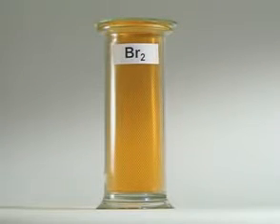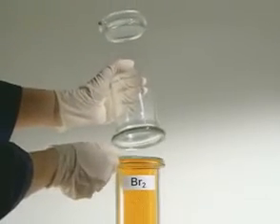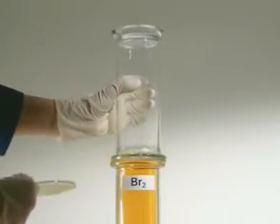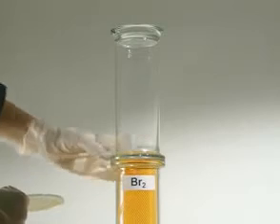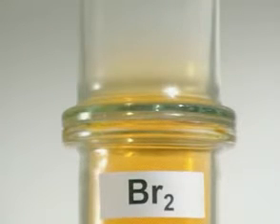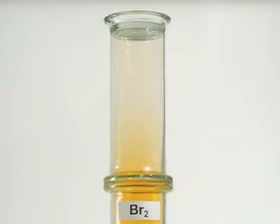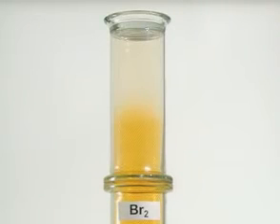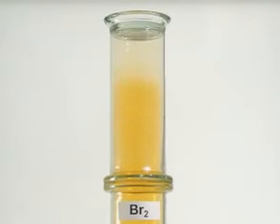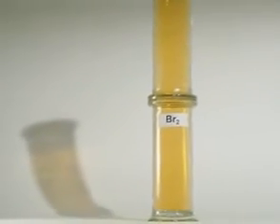You can see diffusion happening on a small scale in the lab using bromine, an orange coloured gas. Place a jar of air on top of the bromine and it slowly starts to spread, moving up the tube against gravity. Over time, the two gases mix, and after half an hour, both containers have a uniform colour.